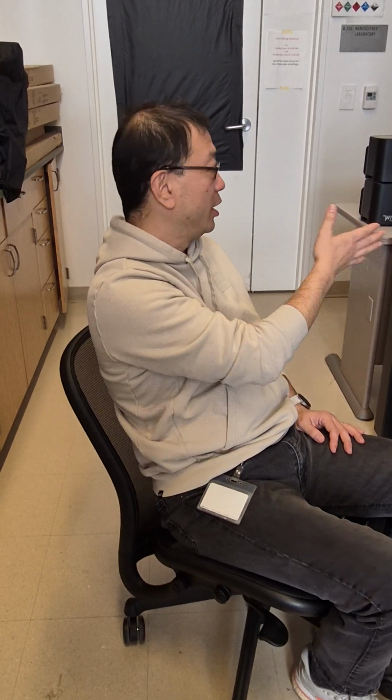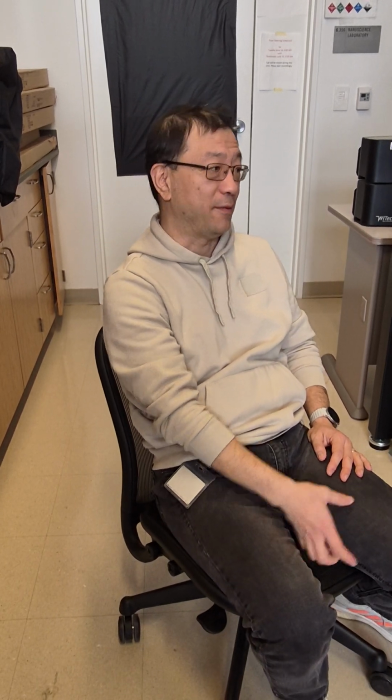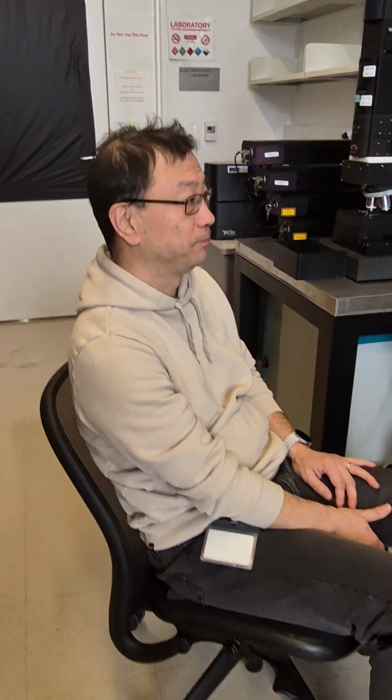For example, for 633, I think the maximum value is 43 or 44 or something. If you input 60, it won't go to 60. It just goes to 44 and stays there. So you will know the maximum value you will get. That's why I suggest trying not to use over 20.